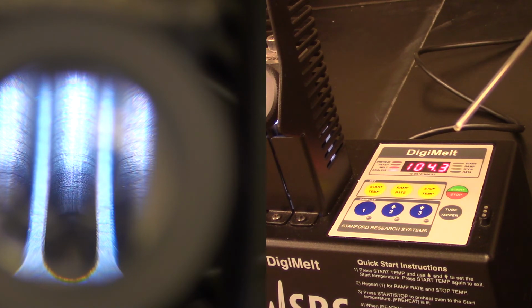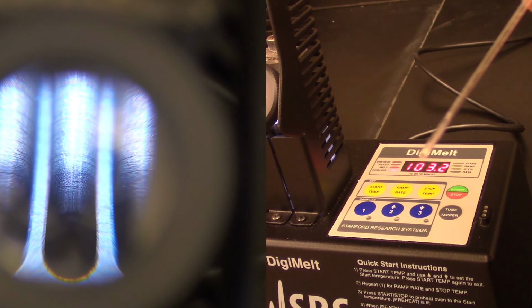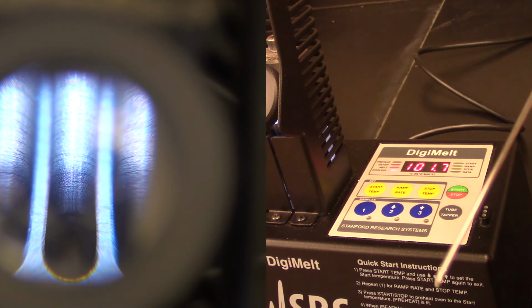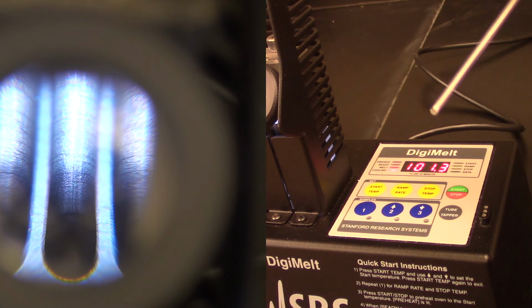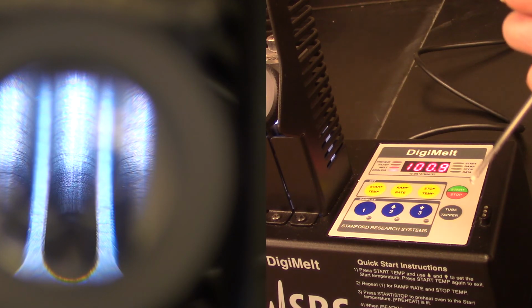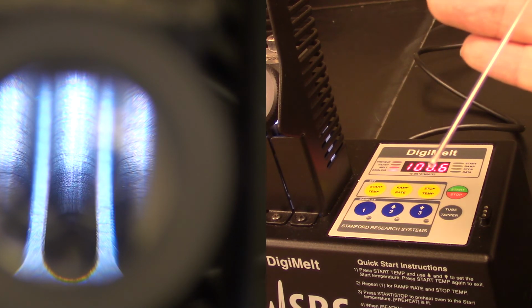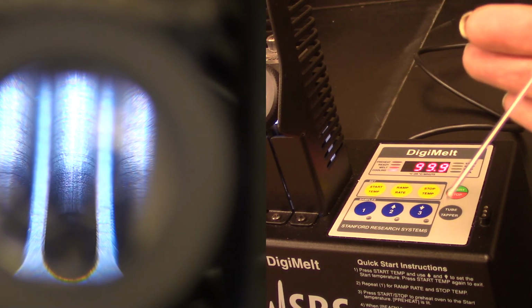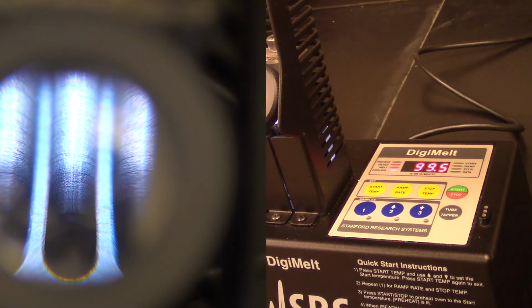The reason for that is if this was impure because you had some kind of solvent mixed in with your compound, while it's sitting there getting heated up inside the heating chamber, you may have actually boiled off that solvent. So that would change the composition of your compound, which would change the melting point range. So you really should start out with a fresh tube every single time. Don't take the same one and run it through the melting point again.